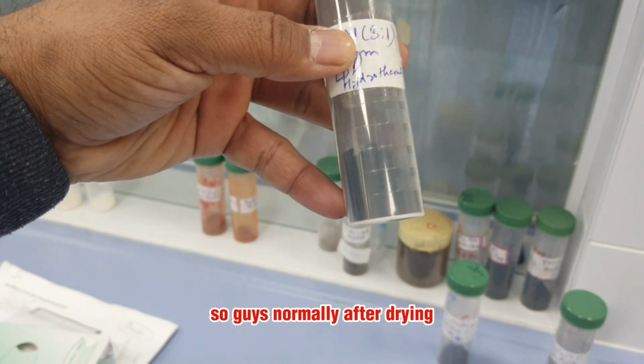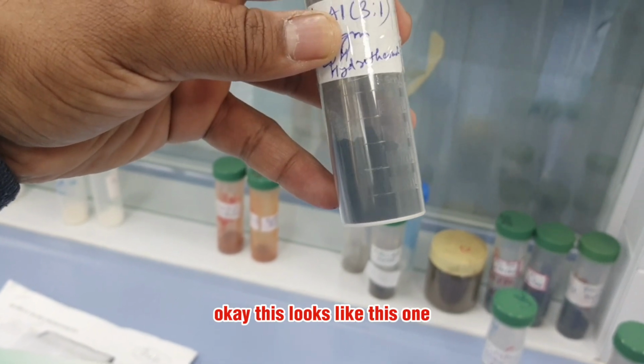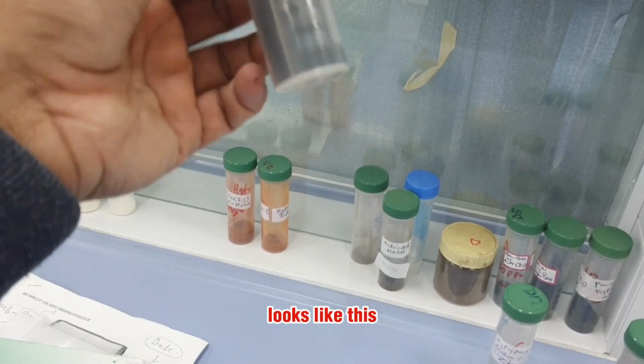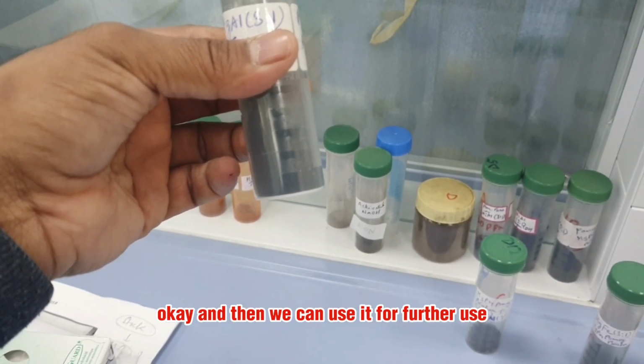So guys, normally after drying, you see the magnesium aluminum LDH. It looks like this one. You can see the magnesium aluminum LDH after drying looks like this. After this we have to crush it, and then we can use it for further use.